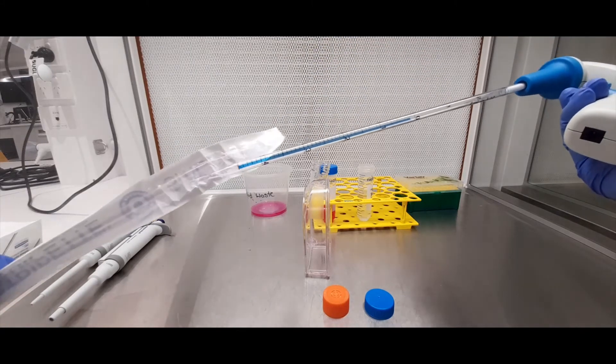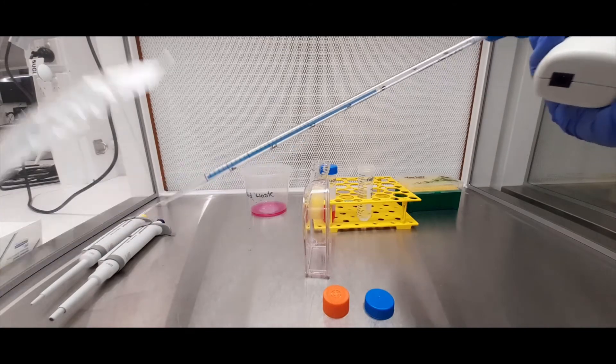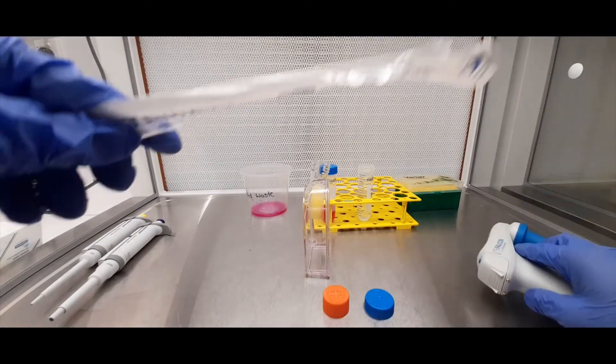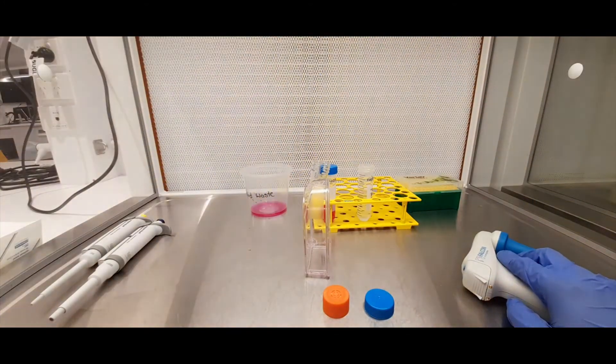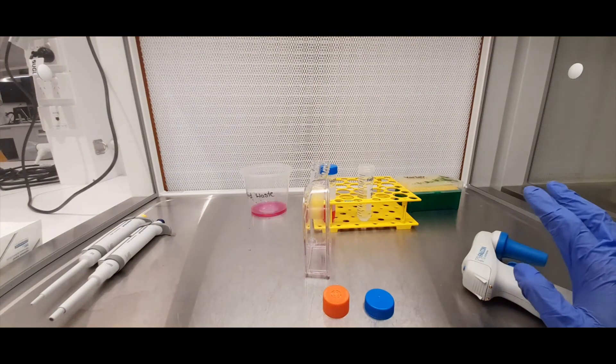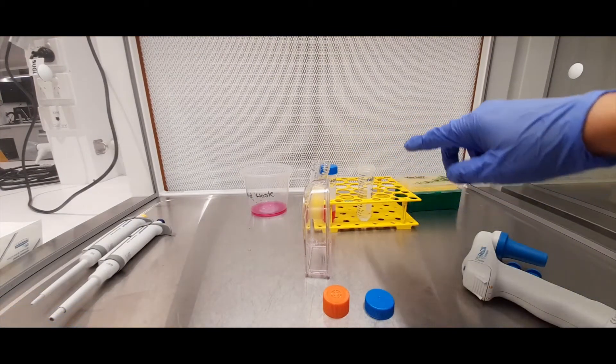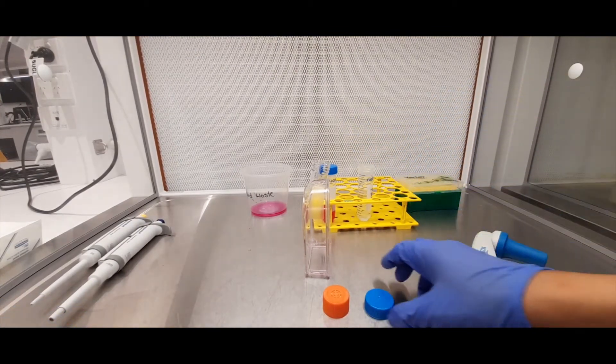These serological pipettes are designed to be single use, so every time when you finish with that, you want to discard that and just get a new one to prevent cross-contamination between your different tubes.